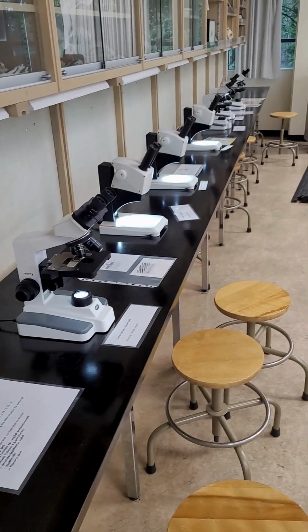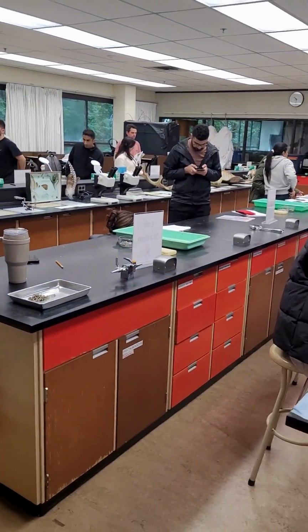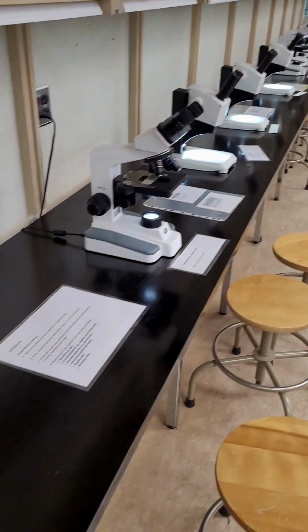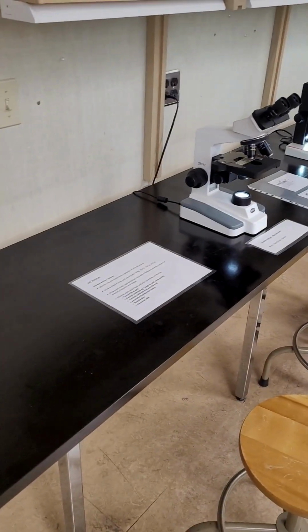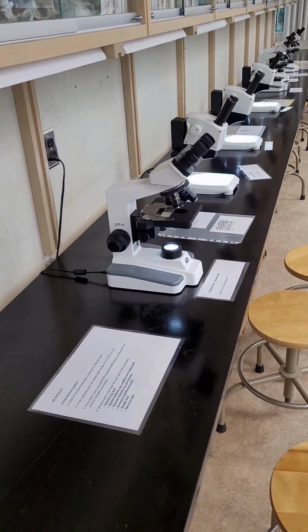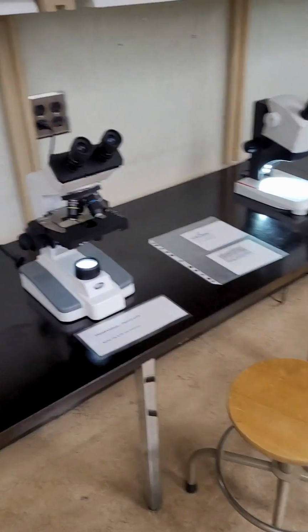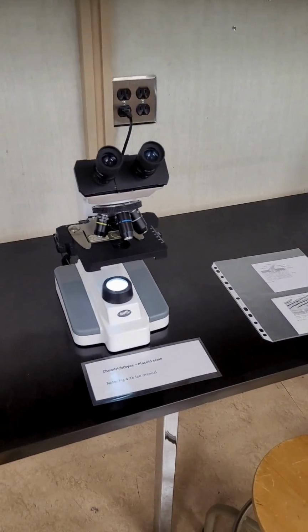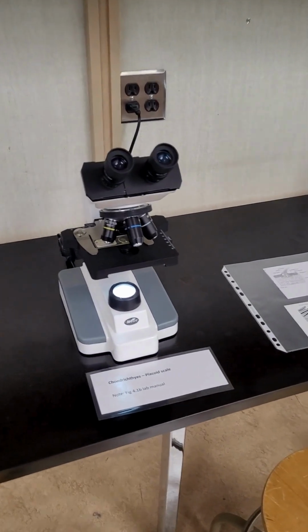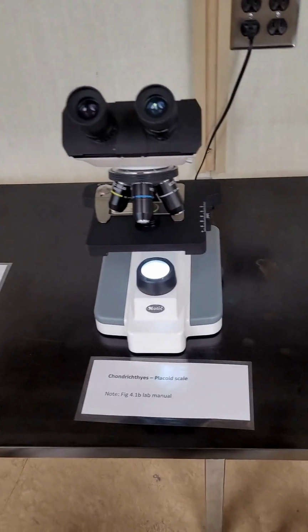So okay, this is the early vertebrate dissection, respiration and integument lab, and we're just going to have a look at the integument here at station 4. So this theme here is about the origin of scales, so that's from dermal armor, which then in our earliest fish forms the placoid scale seen in Chondrichthys, which is then going to be bone with a dentine overlay and then enamel, and these are called the placoid scales.